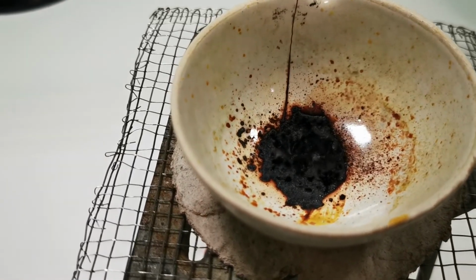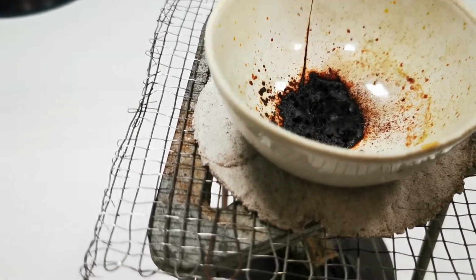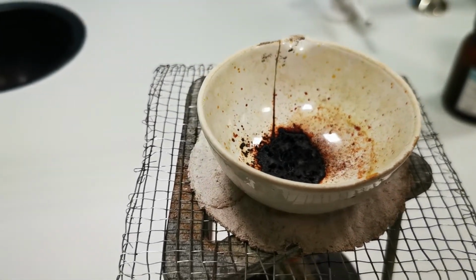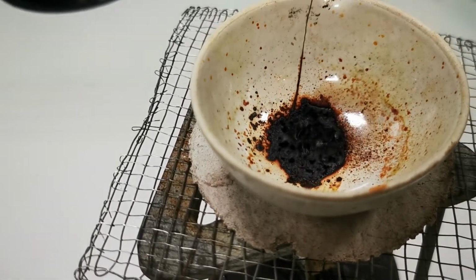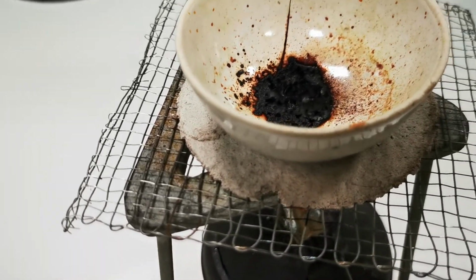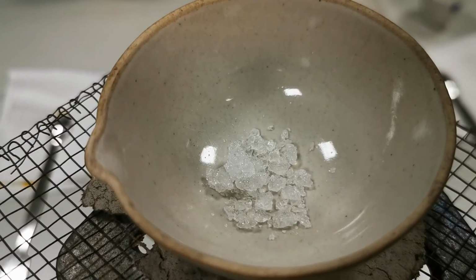So over here I stopped heating it, and now I'll wait a little bit until the evaporating dish cools down, and then I will measure the mass again. Of course, I need to subtract it from the mass of the empty evaporating dish, and like this I will now have the mass of the anhydrous iron chloride. So here again, this is taking some time, the aluminum nitrate.